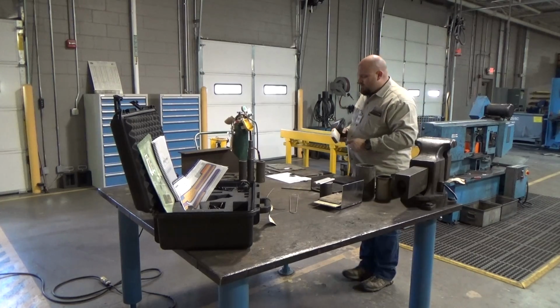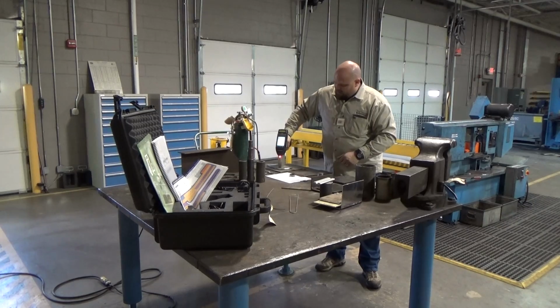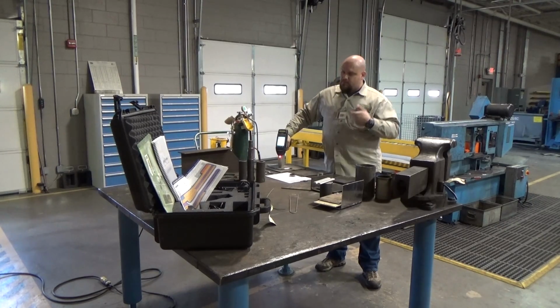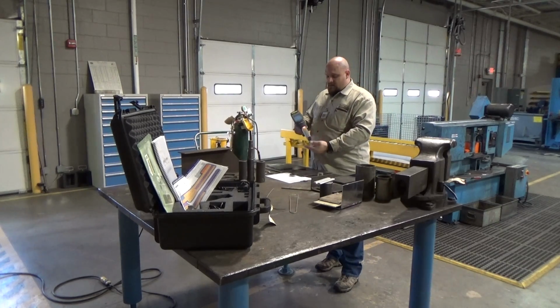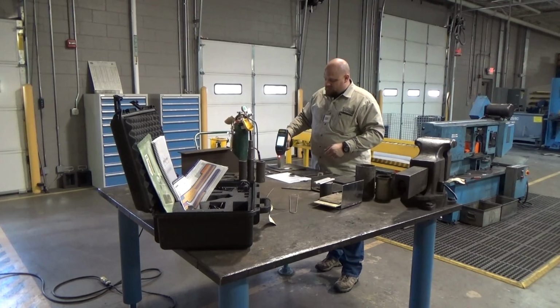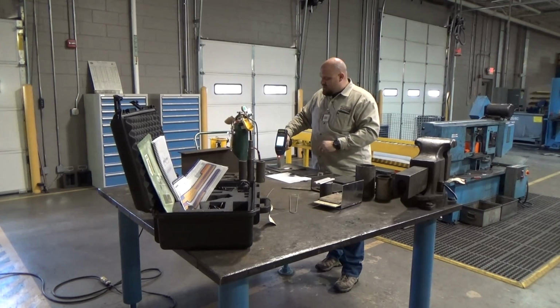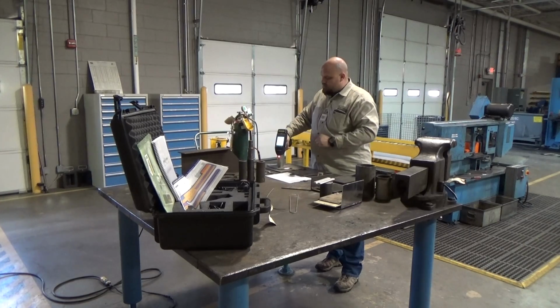But what we go to, and we'll go to one of these materials, rest the gun squarely on it. And again, it does produce radiation, so it's not recommended to be holding an object and shooting it, as you're exposing yourself to that radiation. So we want to go back, take that sample, standing away from it, as such is perfectly safe for the way the equipment's designed. There is a display on the end of the gun, so you're not having to bend over awkwardly to look at the screen in your display. But it's got a timer.